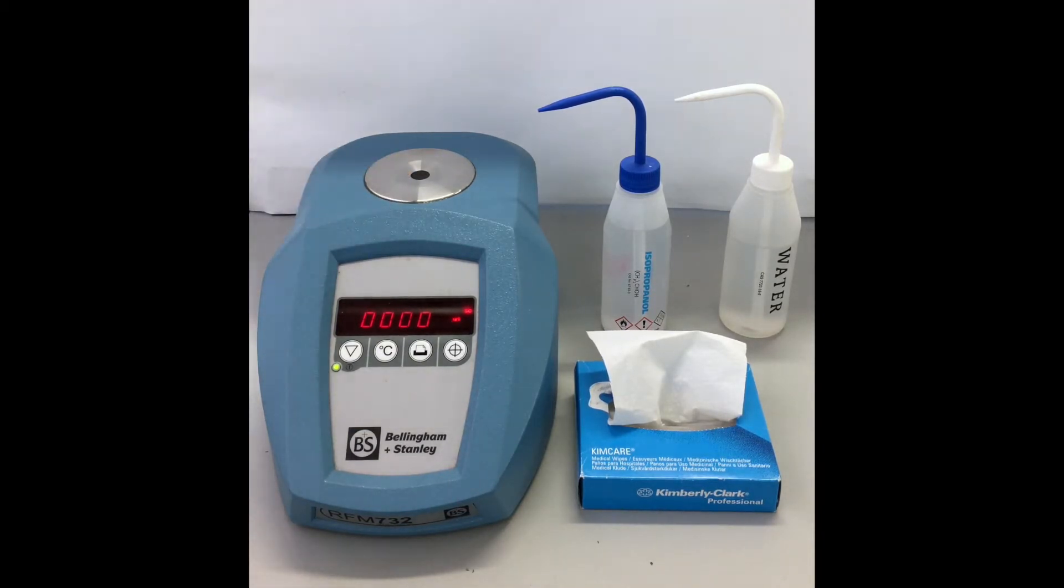This is the measuring prism. This is the prism plate. And this is the display panel.